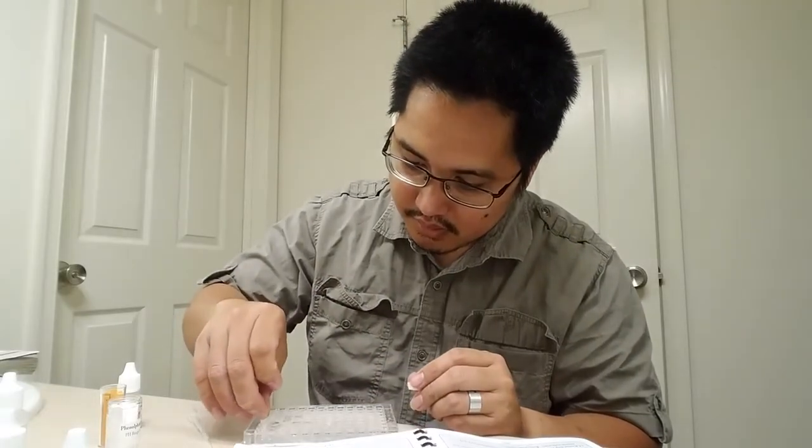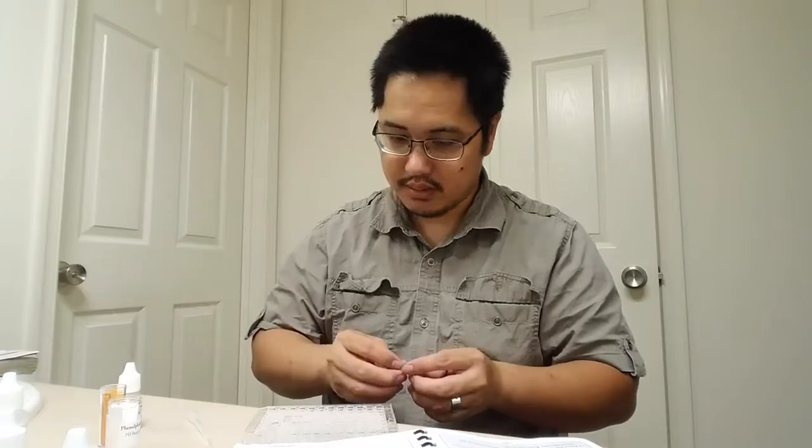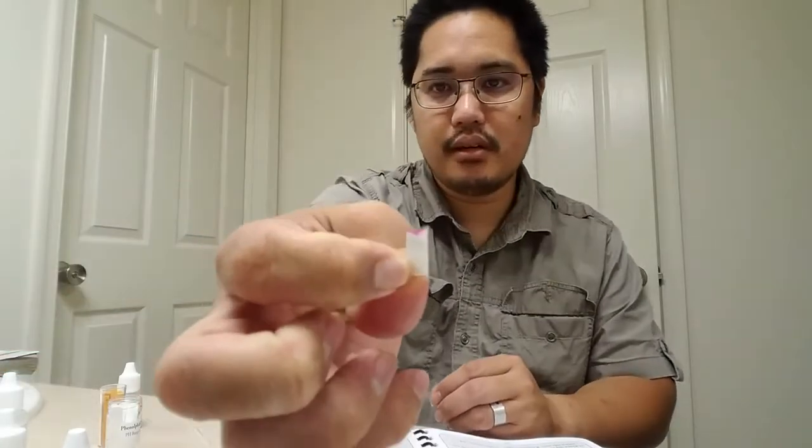Put this one here. Ooh, look at that. You see that pretty color? And I'll put this one in here. Rip off that small piece and put this one in here. See what happens. Oh, look. No color. Interesting. There's that cool little color right here, and no color with the other one.